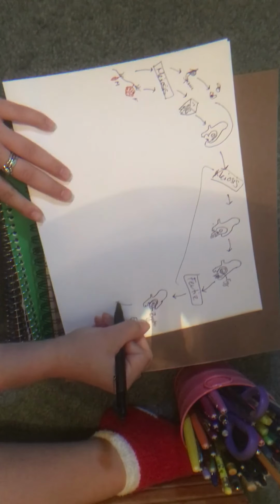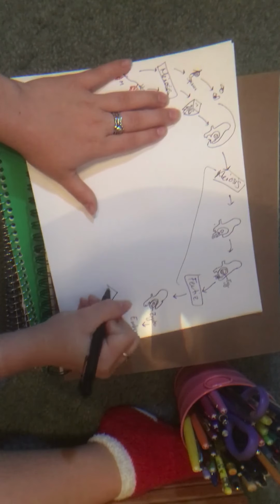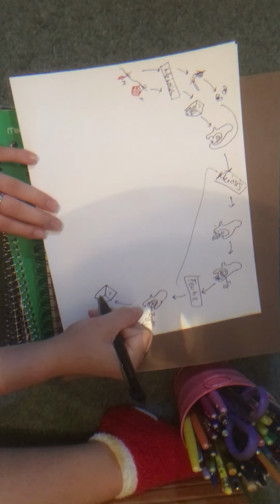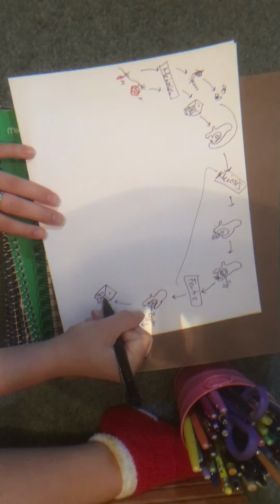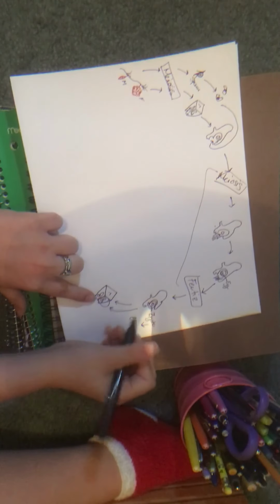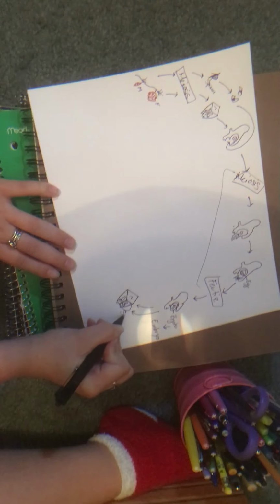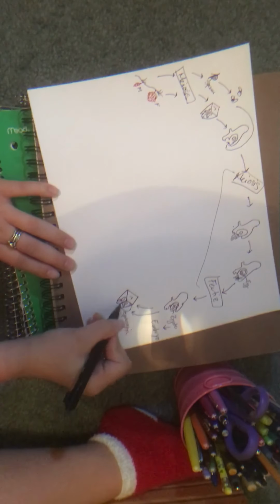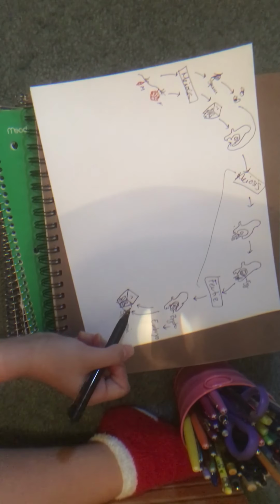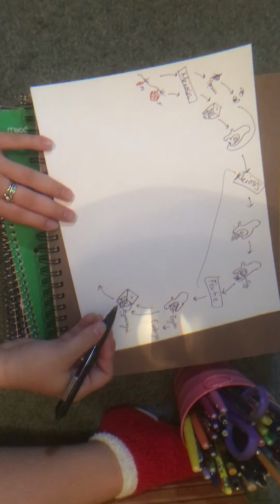So then we zoom out back over to where you can see more of it off the pine cone, off the female cone. It is inside the oval right here. So this is the sporangia of the new sporophyte, with the new sporophyte within. So this also works as the seed.